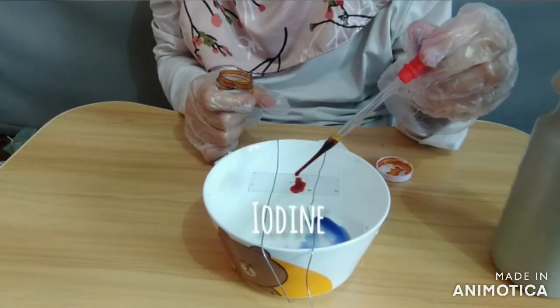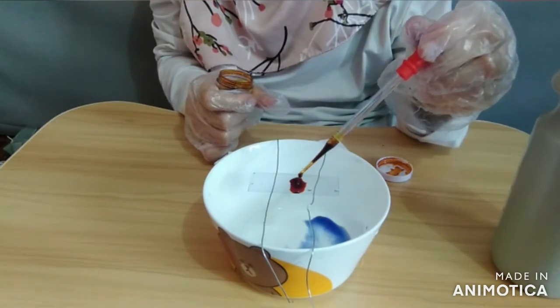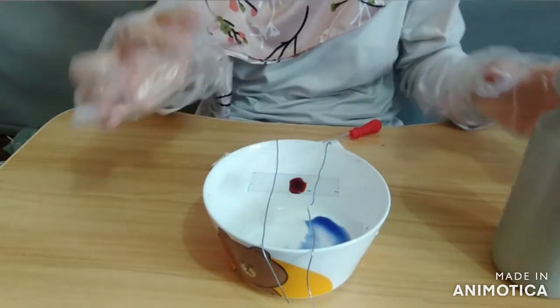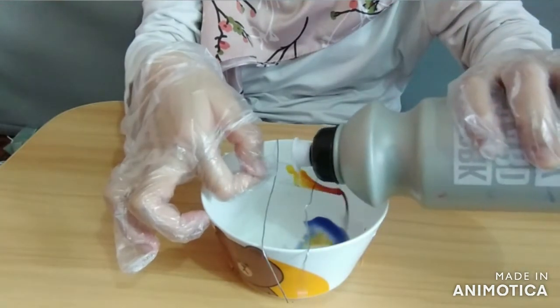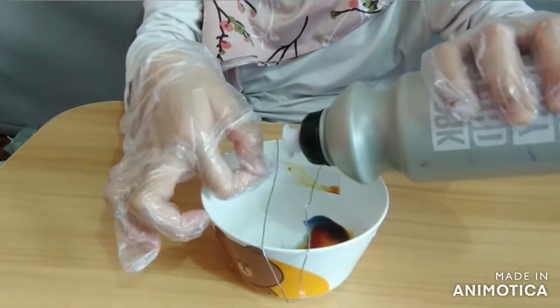Gently flood the smears with Gram's iodine and let it stand for 1 minute. After 1 minute, gently wash off the stain with tap water.